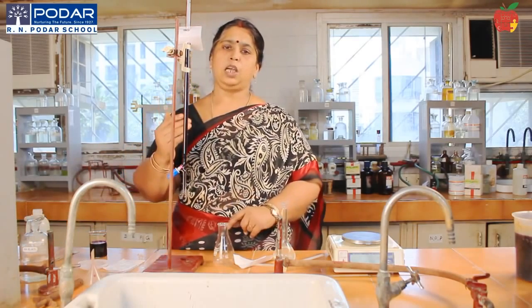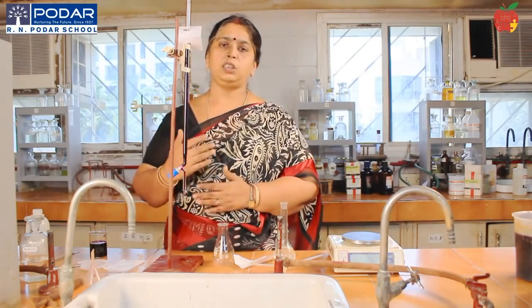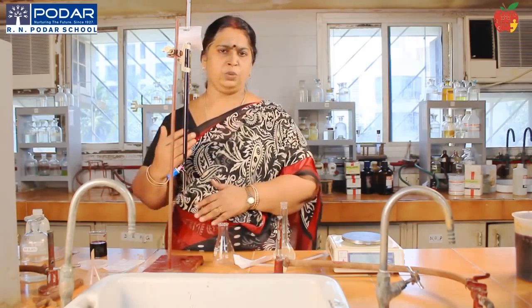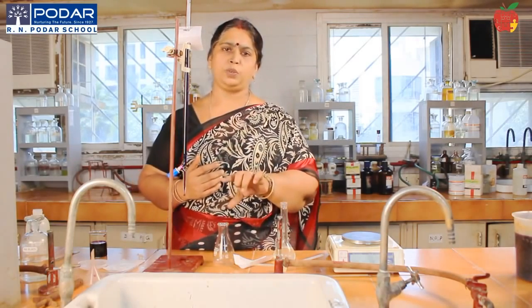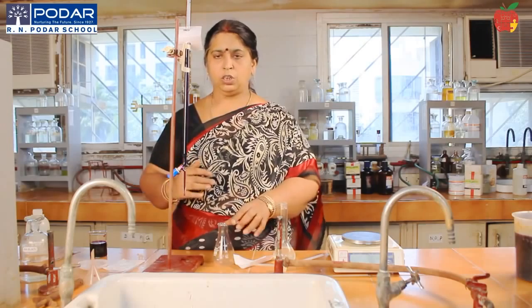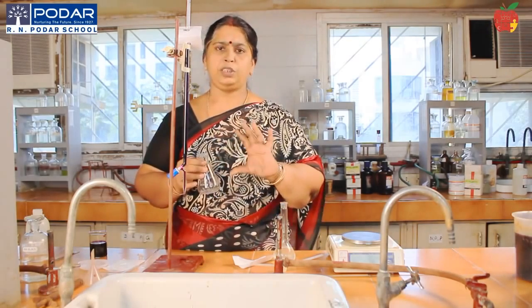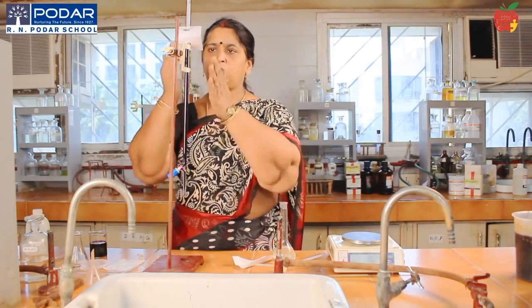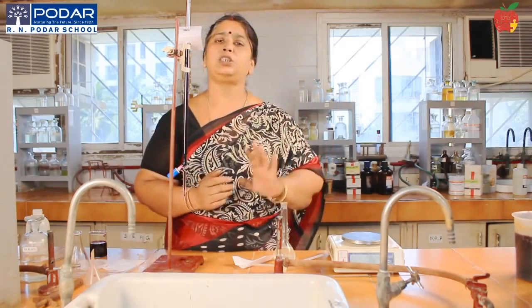When I repeat, the experiment is repeated thrice, out of which 2 consecutive readings should be the same value. Those 2 readings which are of the same value are called the concordant values. Okay, so this you have to do. See for the color, don't forget to add dilute sulfuric acid. So this experimental part is very important. After having noted the values, enter them in your paper and get it attested from the examiner.